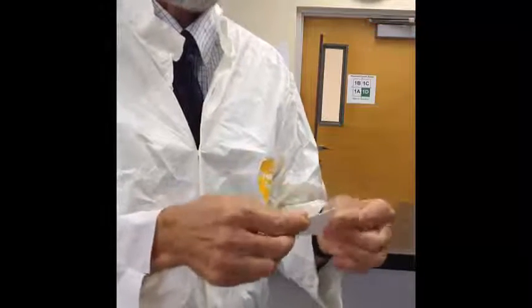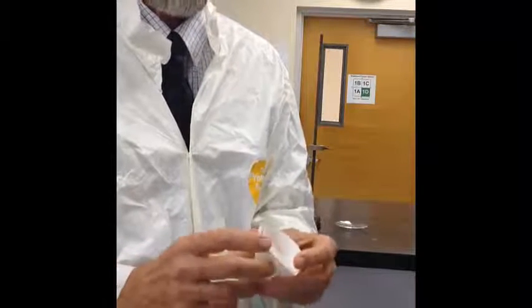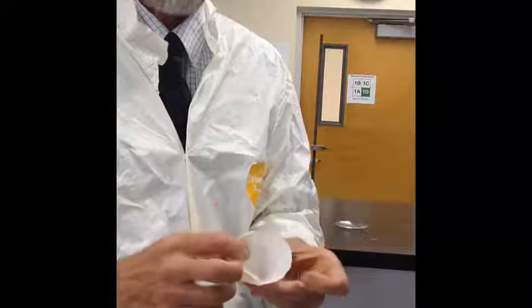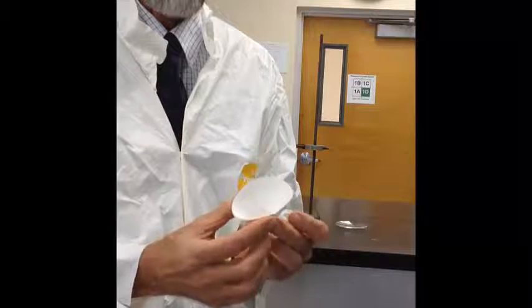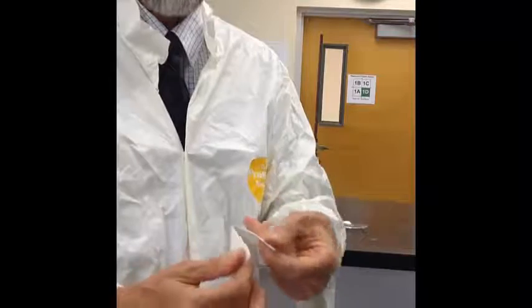We'll place the filter paper in a filter funnel. Whenever we place a filter funnel on the tabletop, store it with the stem pointing up so that it doesn't roll. Don't lay it down or it'll roll off. Fold the filter paper in half once, and then fold that in half again, which will give us a quarter circle of filter paper. We'll open that filter funnel up then so that we have one thickness of paper on one side and 3 thicknesses of paper on the other side. This creates a funnel which will hold the sand and keep the sand from washing down into the evaporating dish.